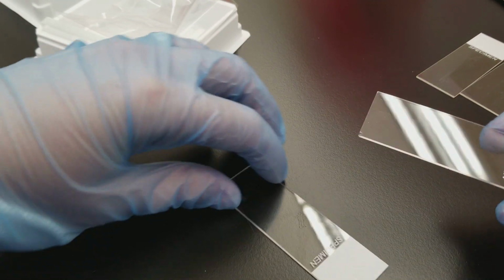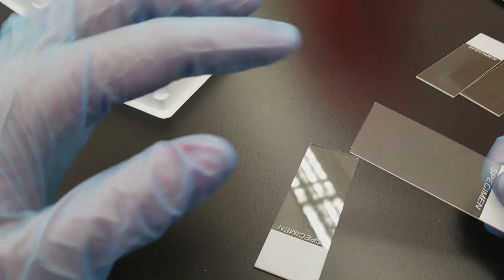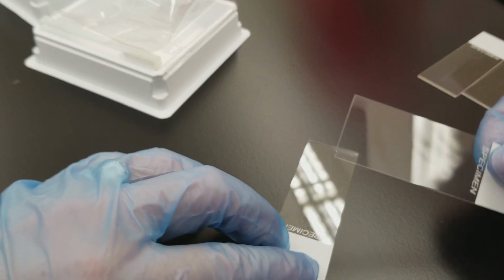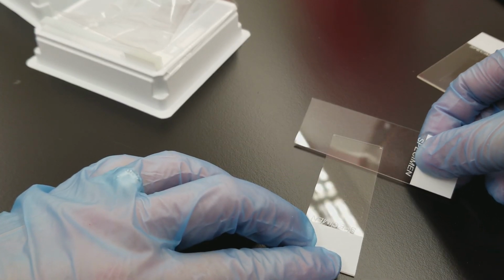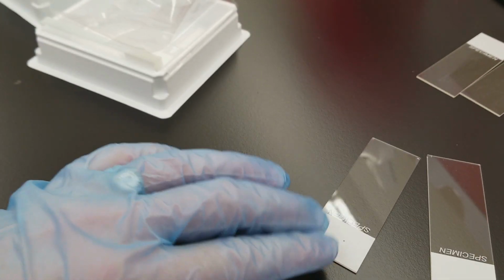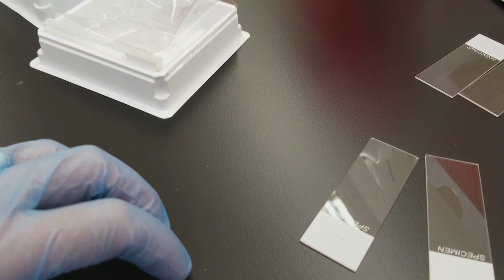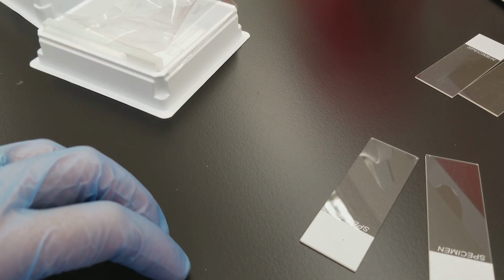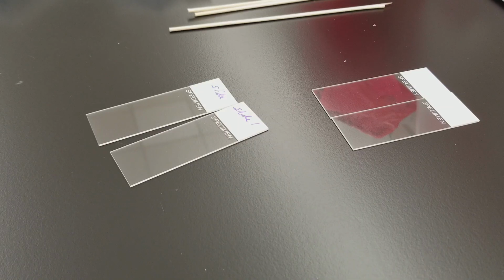So what we're going to try to do today is put the drop, and obviously the size of the drop is important, but we're going to use the side here, and we're going to spread it this way. It was extremely amazing to me to see this person do it. So we're going to try it and see if we can make this look really great. Let me get this stuff prepared and I'll be right back.